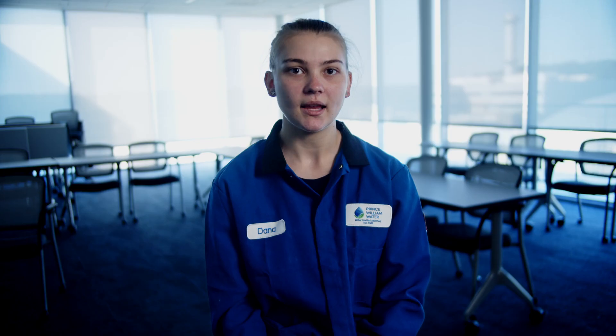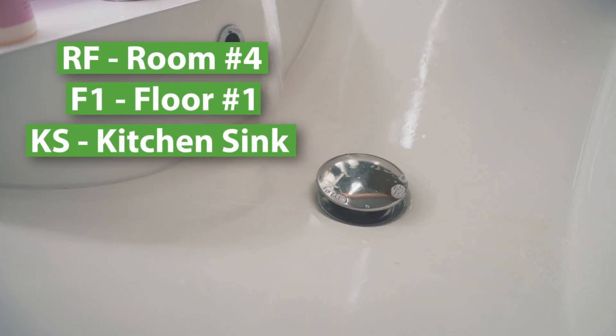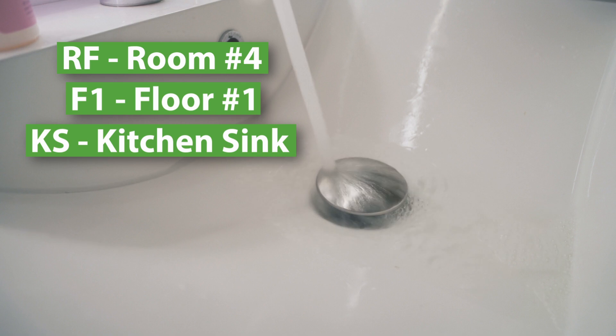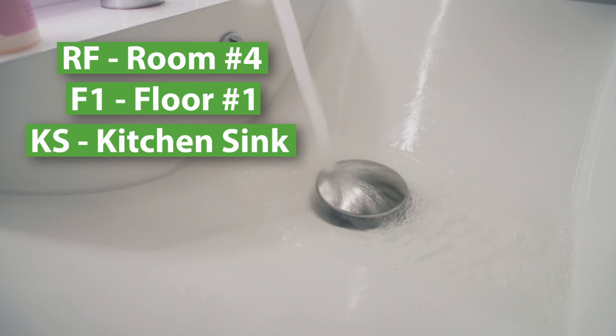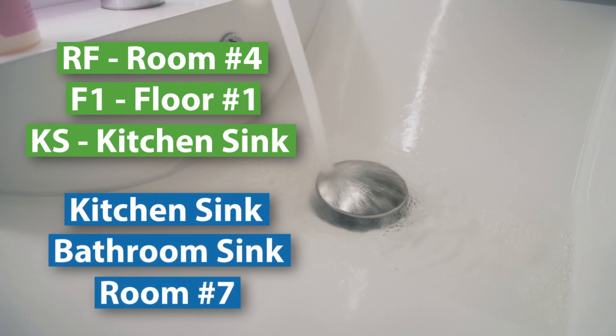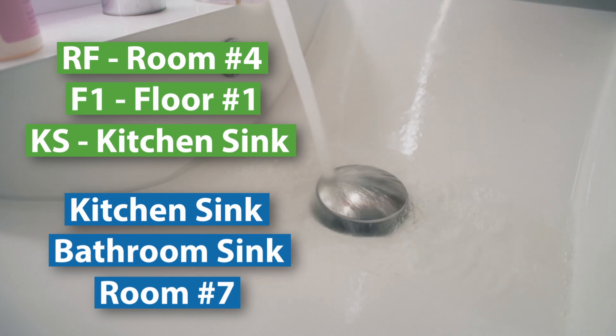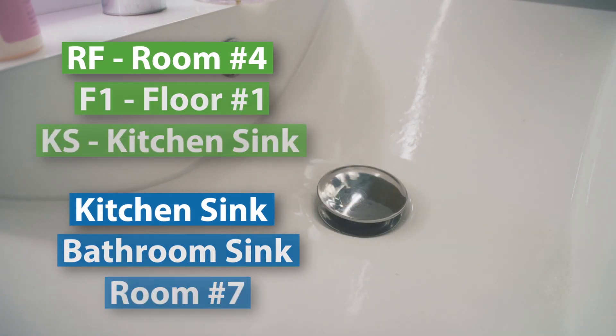Next, you must establish an identification system for each sink. You may find it helpful to code the sinks using a system that allows each unique outlet to be identified by location, type, and other relevant characteristics. For example, R4F1KS represents room 4, floor 1, kitchen sink. Or you can simply label it kitchen sink, bathroom sink, room number 7, or whatever makes sense to you — which is the important part.